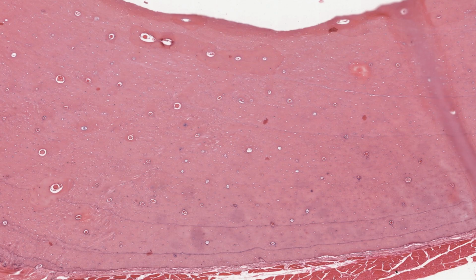The bone tissue is made up of a series of parallel sheets called lamellae. Osteocytes are visible as small, spidery-like cells between the lamellae. In the outer part of the bone here, the lamellae are circumferential. That is, they extend around the entire circumference of the bone. These were laid down, one after another, under the periosteum. Bluish lines between some of the lamellae make them particularly obvious.